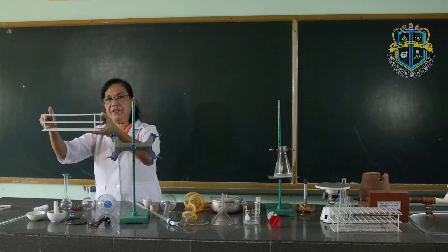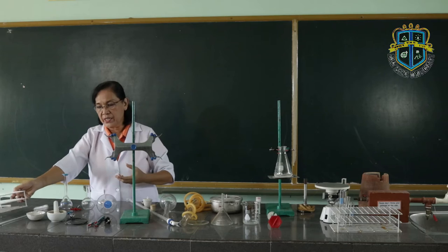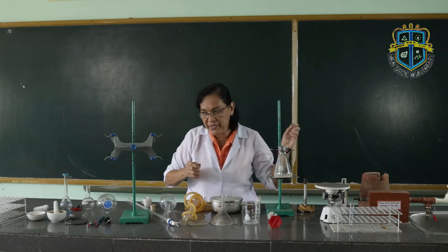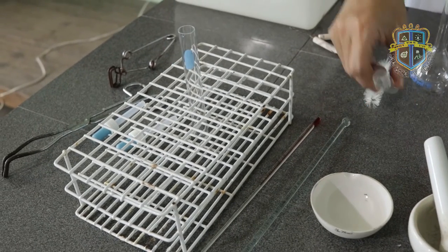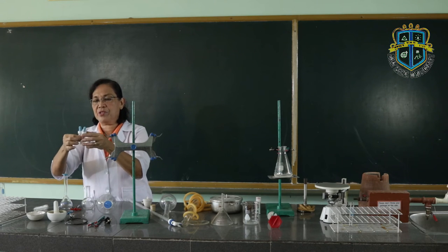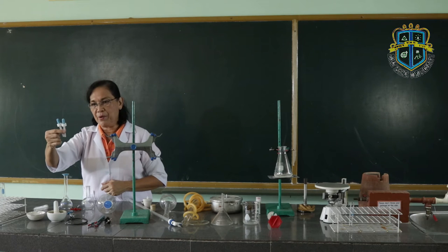Then we have the test tube rack. The test tube rack is where you place the test tubes for safety purposes. So for example, if you have these test tubes and you need to place them safely, put them into the test tube rack. Then we have the medicine dropper. This is used to transfer a small amount of liquids from one vessel to another.